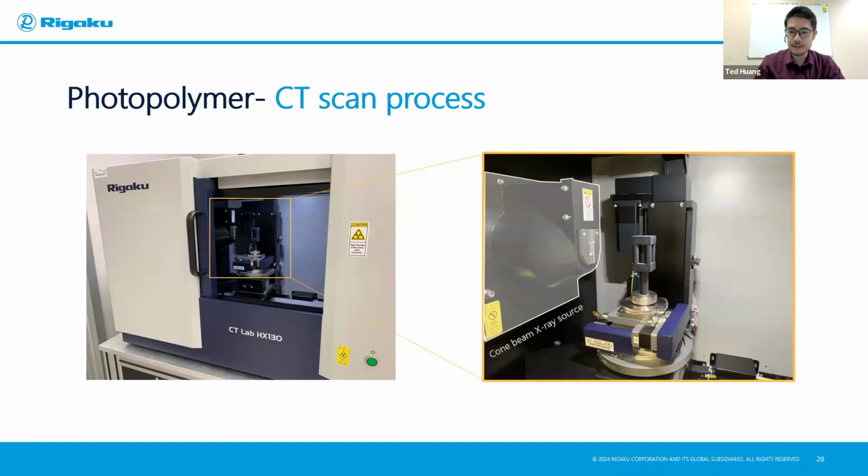And on the left, this is the cone beam X-ray source. And when the X-ray turns on, this is roughly how the X-ray shines, where we get our image. And this one, we have actually quite a good voxel resolution. Despite being a small profile benchtop, you have a highest voxel resolution of 2.1 micron.